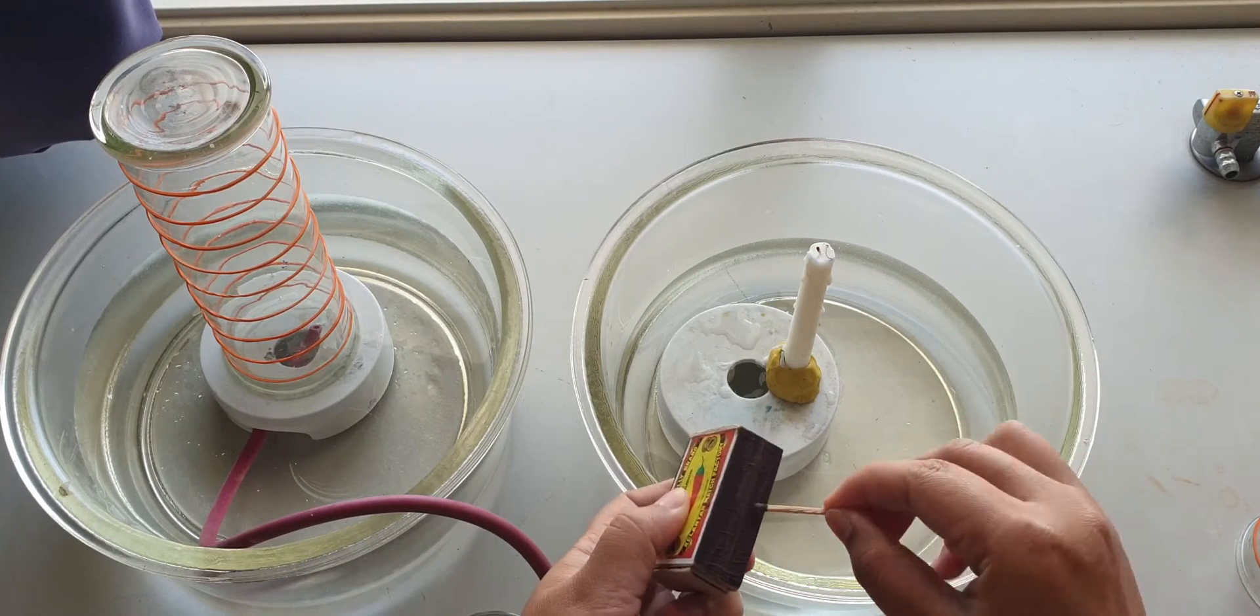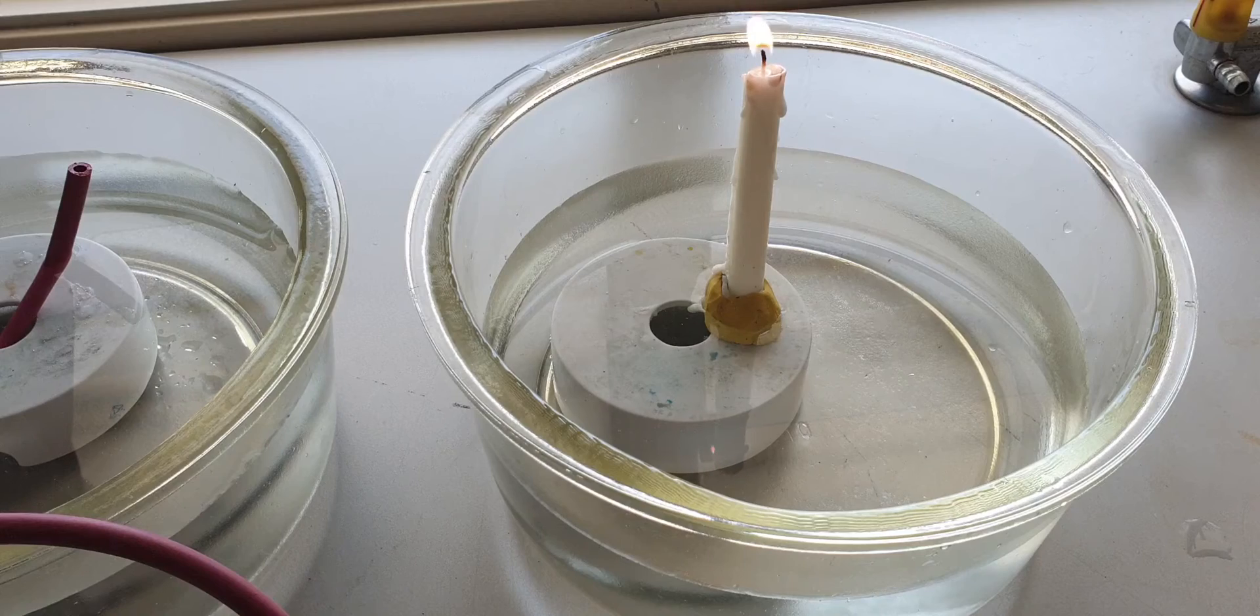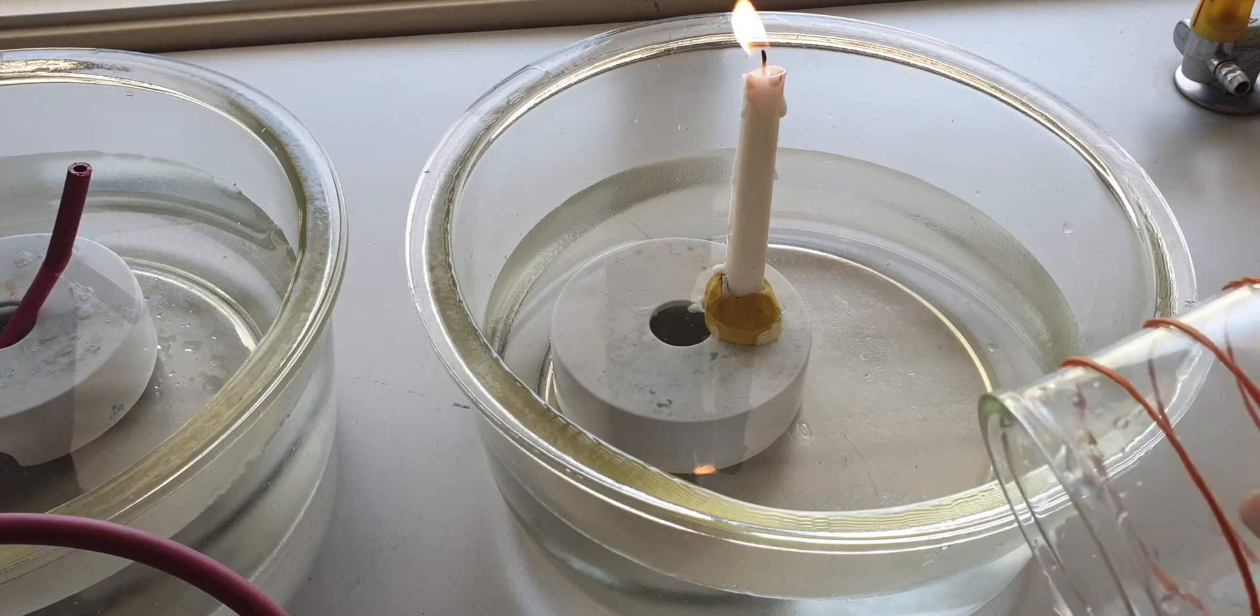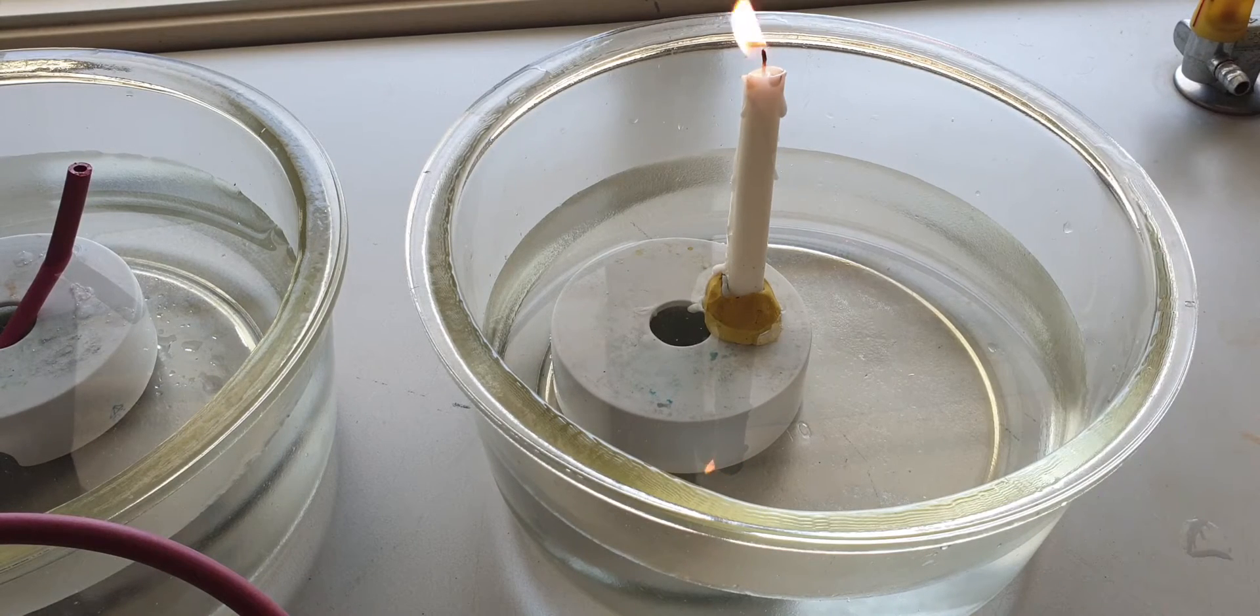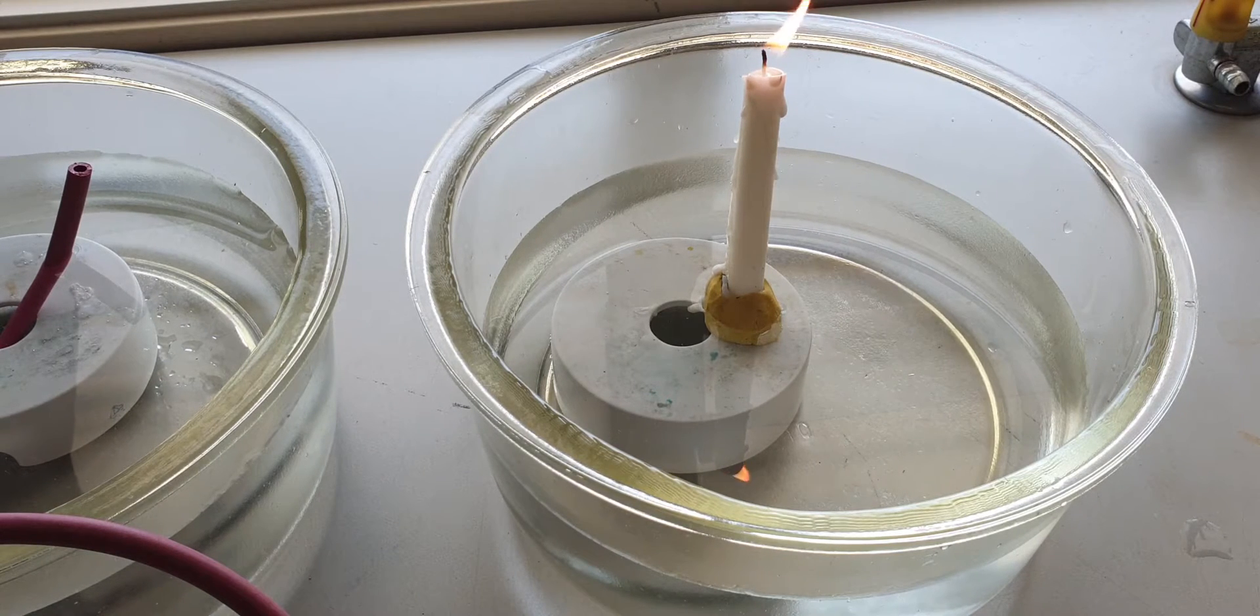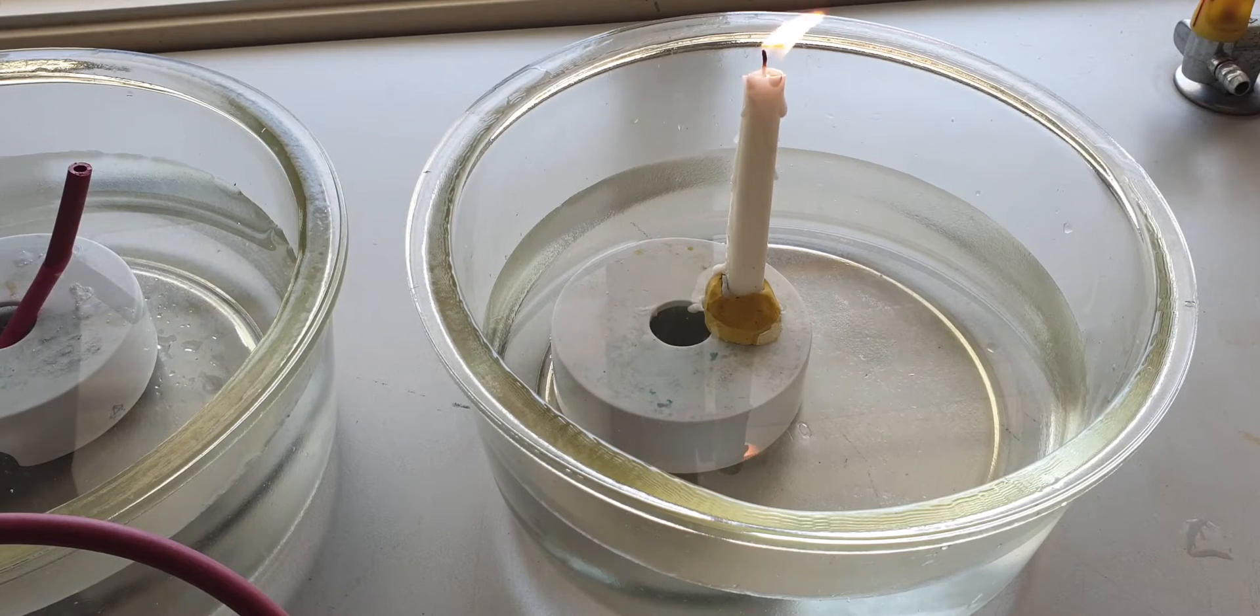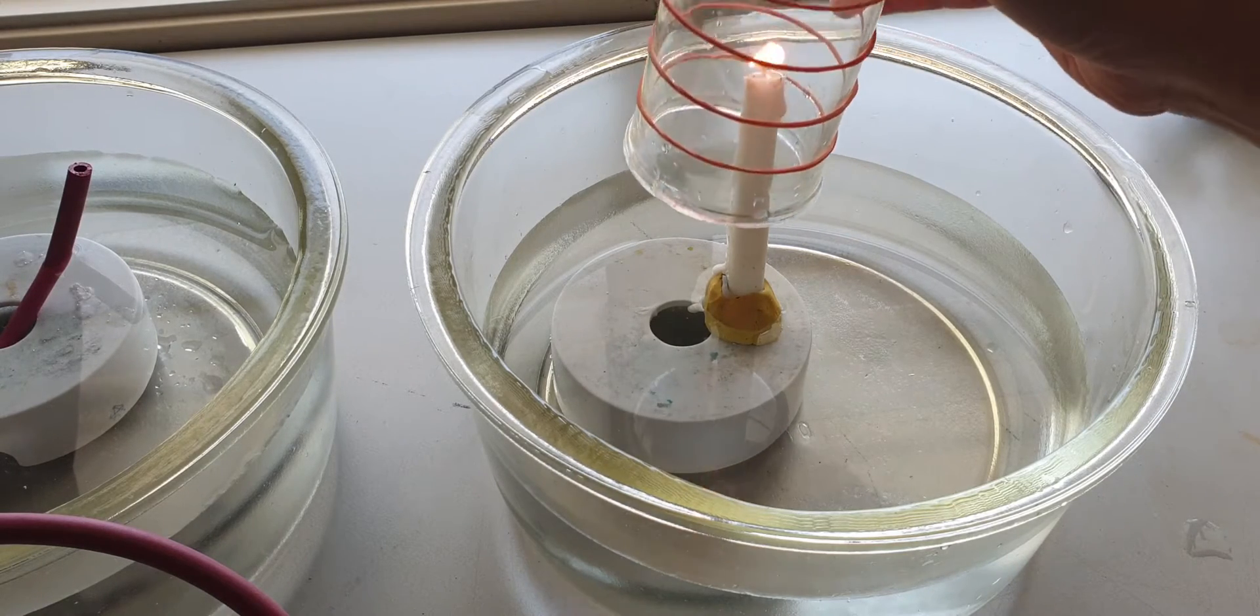So I will light the candle and invert the gas jar that contains inhaled air into the candle. Since the inhaled air is the same as the air that we breathe in around us, we just collect the air around us and just invert them onto the candle.